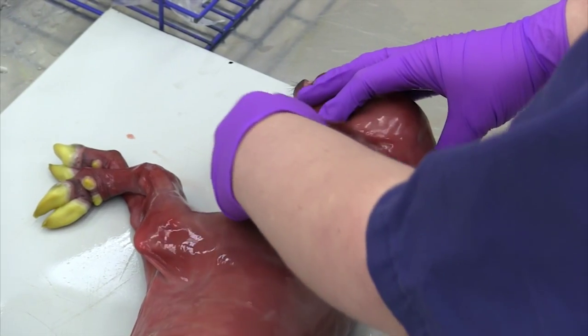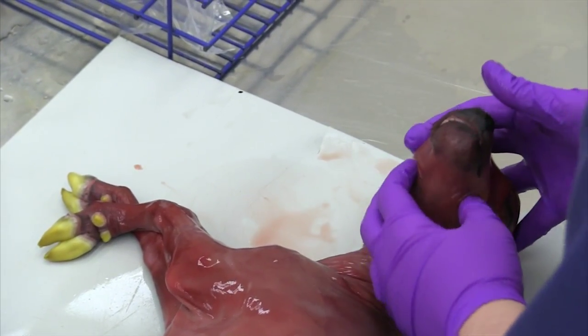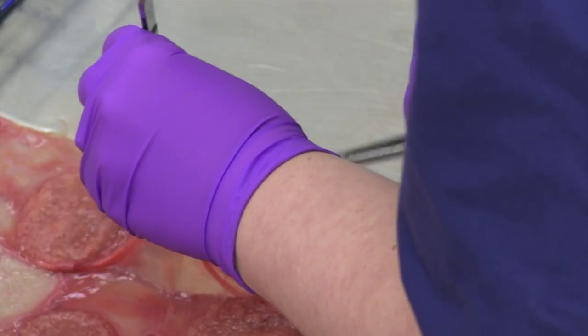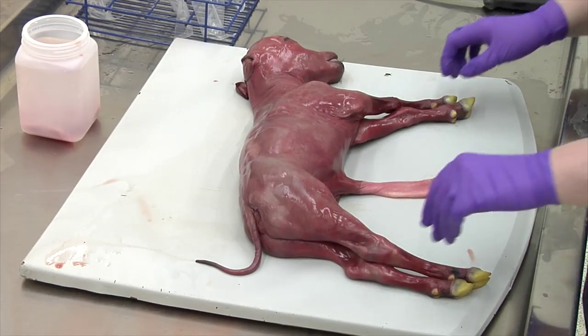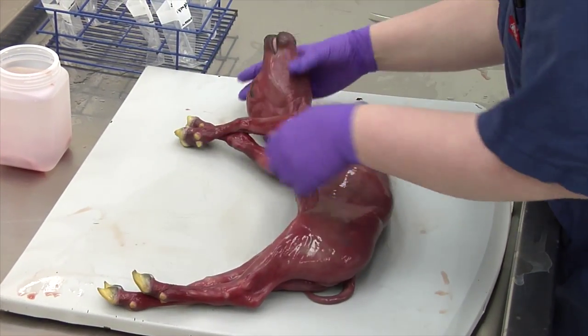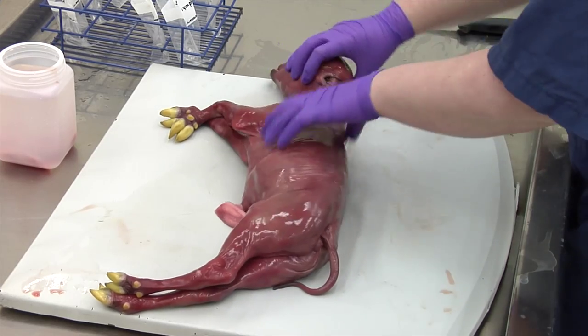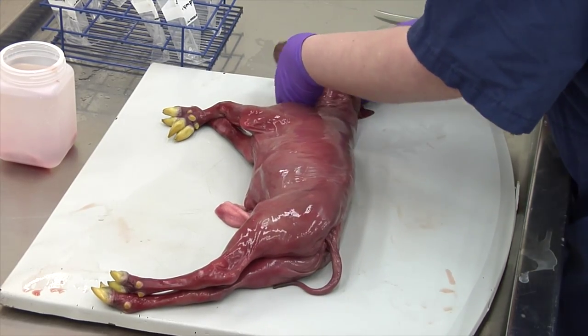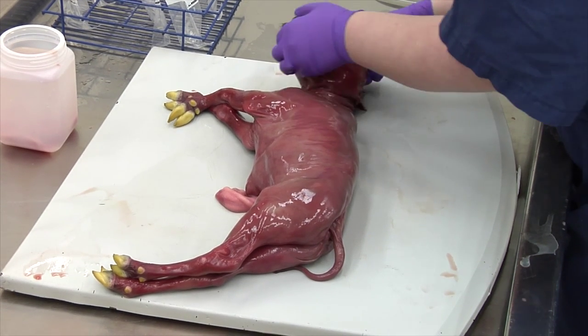The ideal specimen to submit for an abortion or stillborn workup is the entire fetus and a portion of the placenta. This is not always possible due to the size of the calf or the time constraints that may occur over the weekends and holidays. Therefore, collecting and submitting appropriate samples are necessary in certain situations when not submitting the entire calf. Submitting all of these samples that are available will give KSVDL the best chance to deliver a definitive diagnosis.